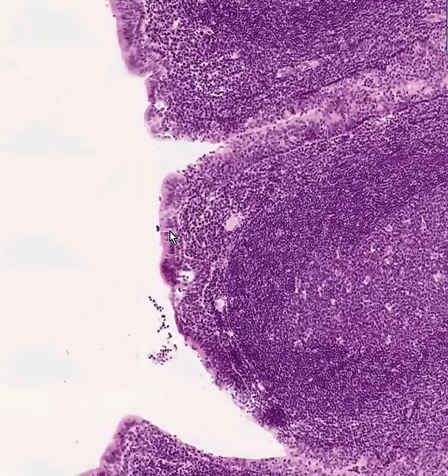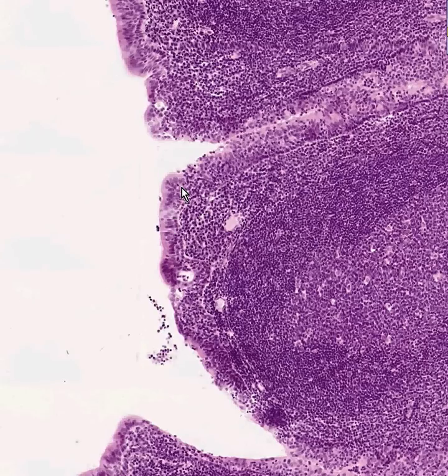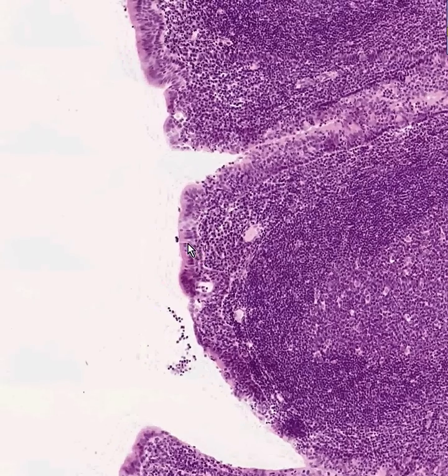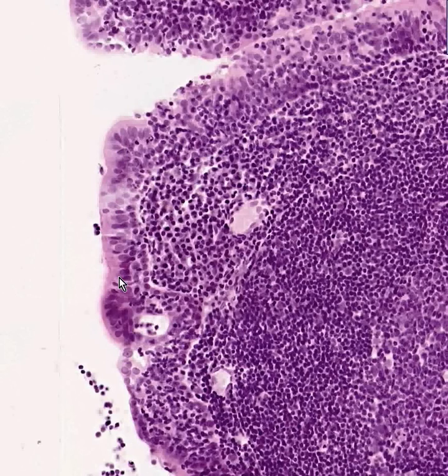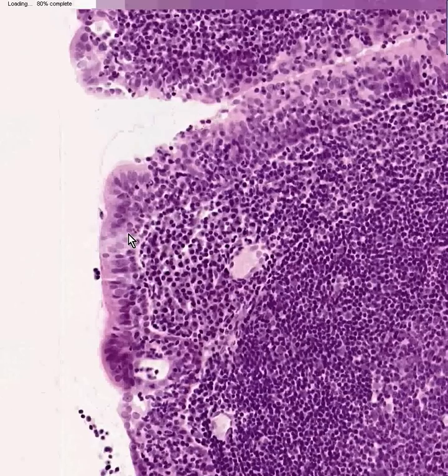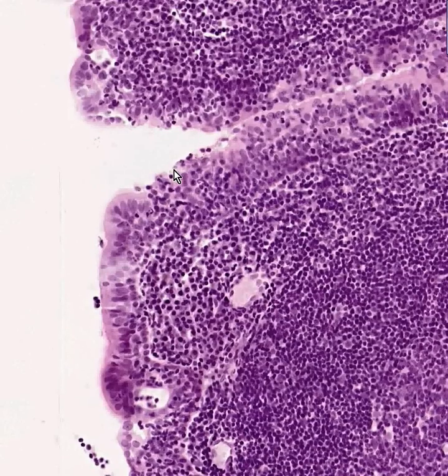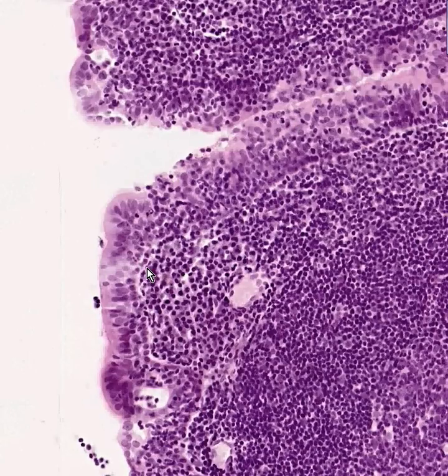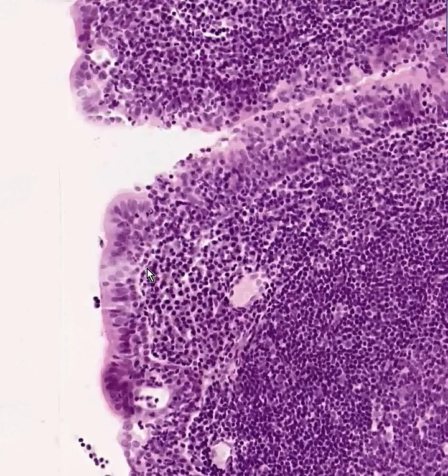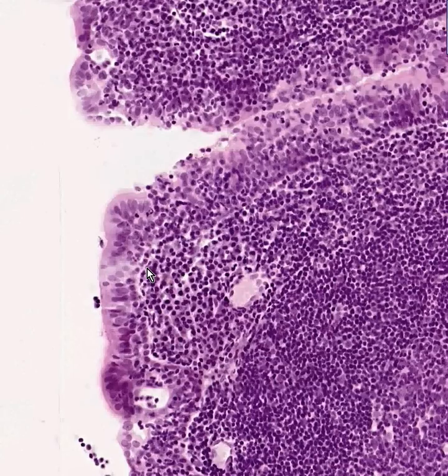So we know that these tonsils are something other than palatine tonsils, and because the normal mucosa of the nasopharynx is a ciliated pseudostratified columnar epithelium — like we see here — which slightly enters into the lymphoid area as well to increase the interface between the lymphoid cells and the epithelial cells, this is a pharyngeal tonsil found in the nasopharynx, otherwise known as adenoids, especially when they become enlarged.